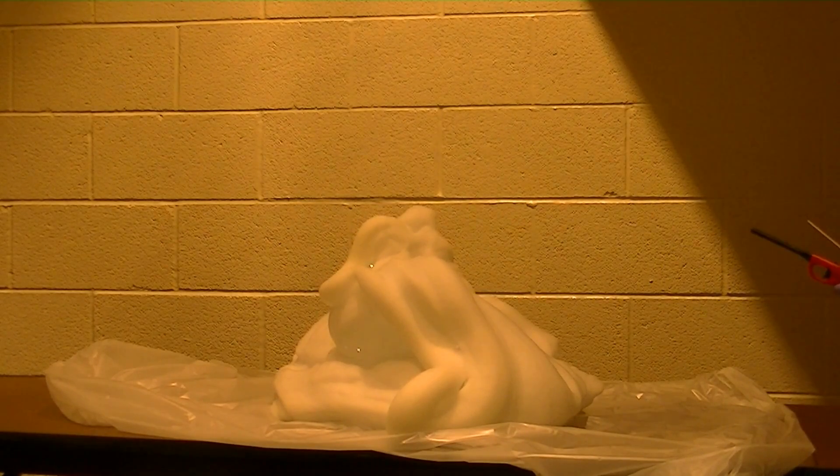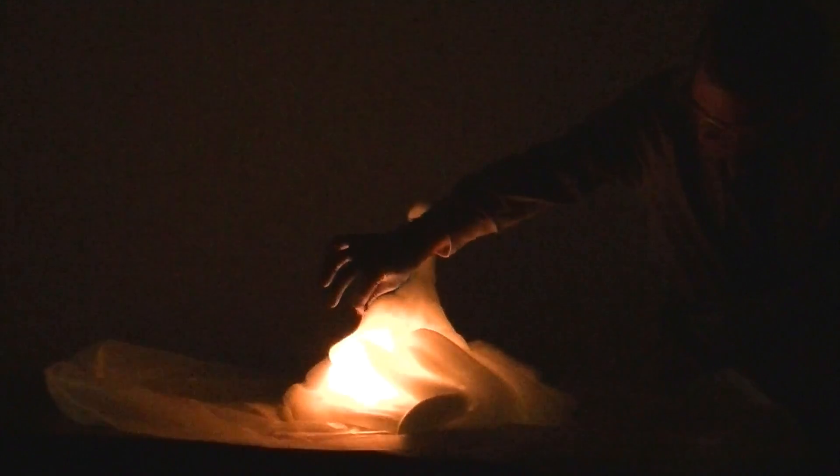Something I like to do with my students is to show them that there is oxygen gas in the foam. You can do that by taking a glowing splint — burn it first, then blow it out so it's just glowing. This splint will burn better in the suds because that's a pure oxygen environment. You get a nice effect. The splint burns much better in the pure oxygen environment in the foam than it does in air.